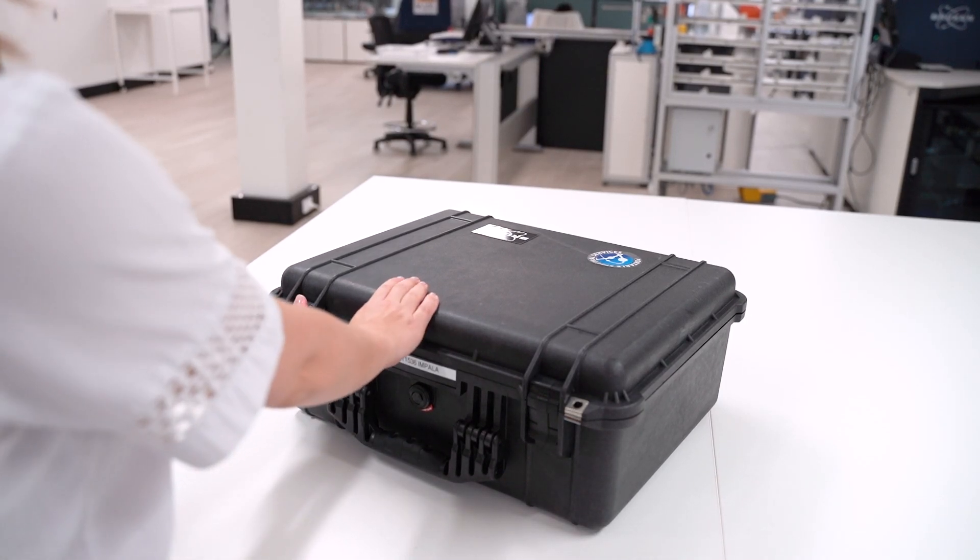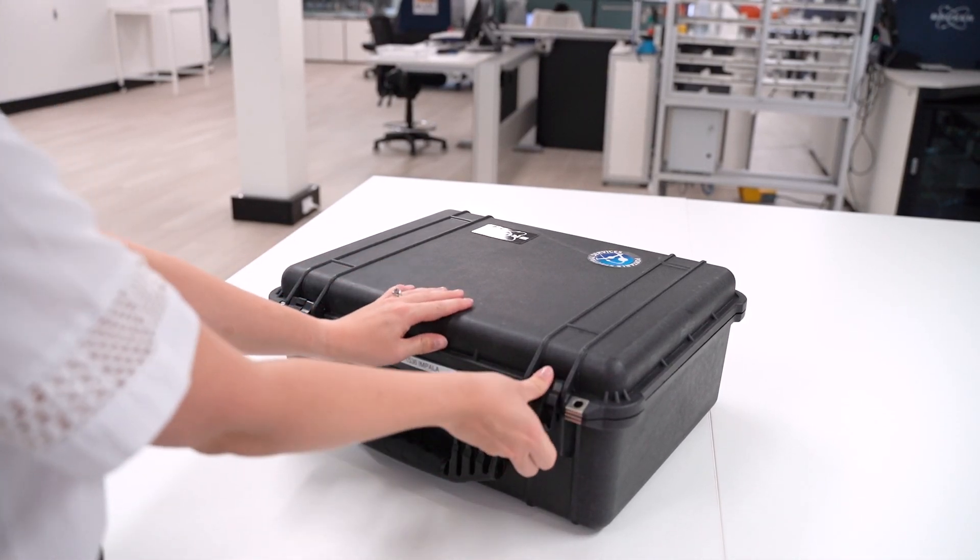Welcome back to Professor Spectrum. Today we're looking at how to get started on your portable XRF.